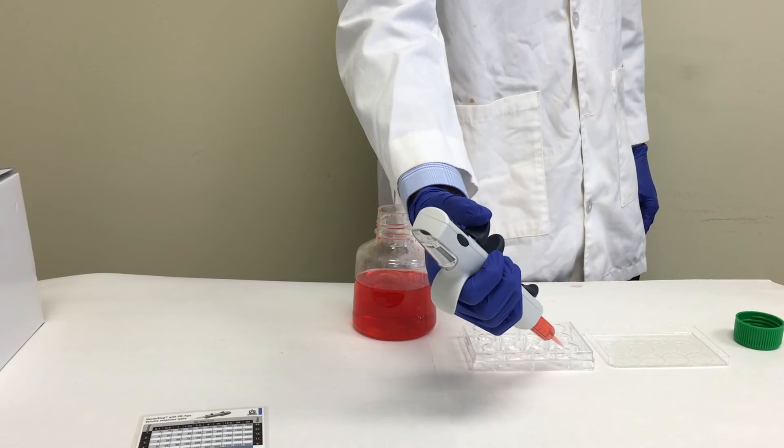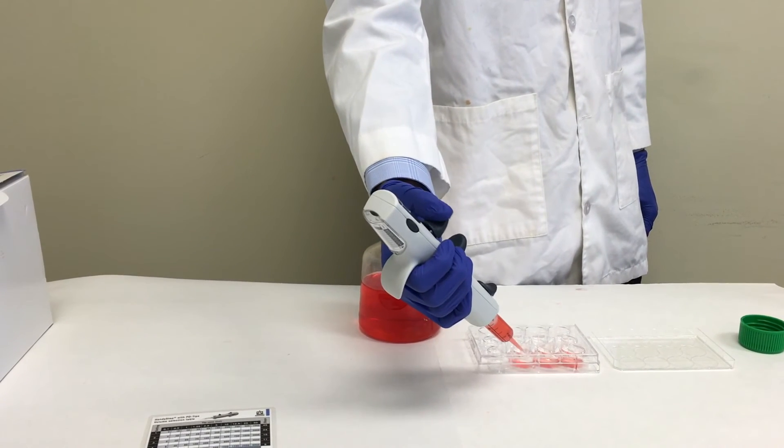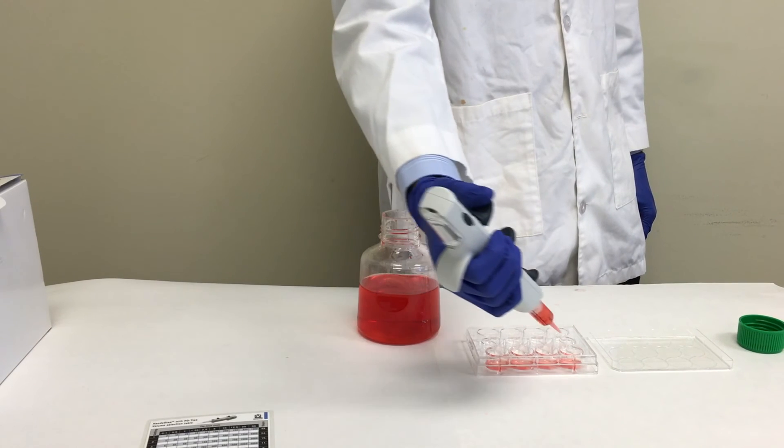Then, press down on the dispensing lever to begin dispensing. This process should be fairly easy, and you should feel little resistance.